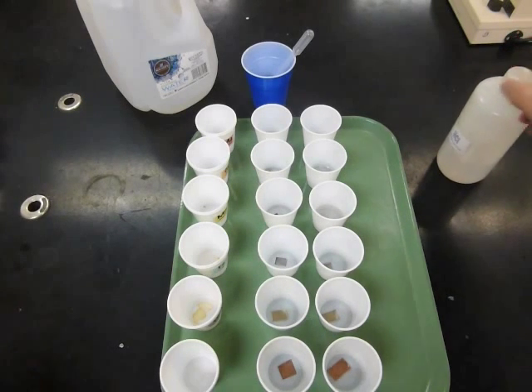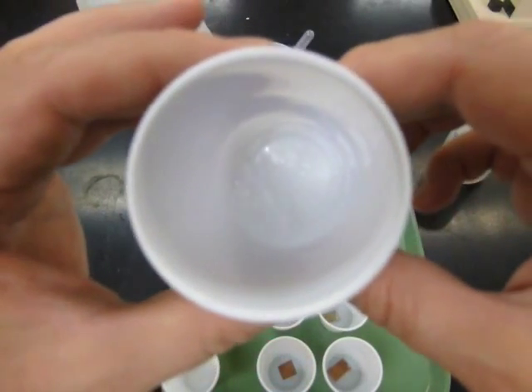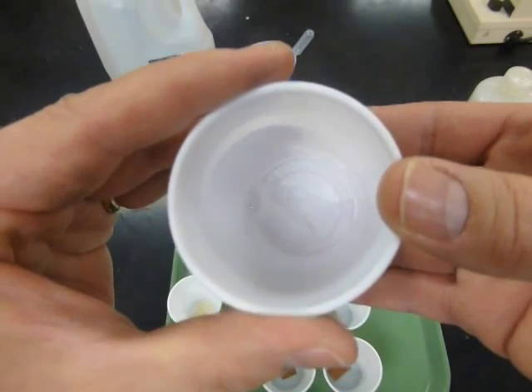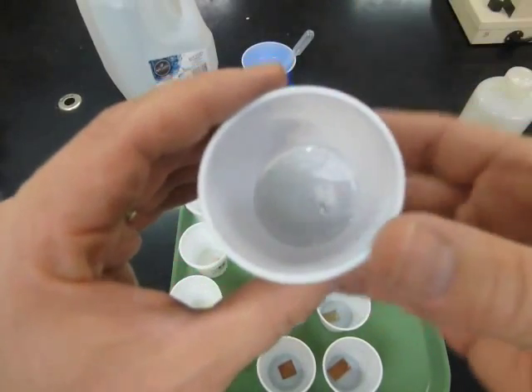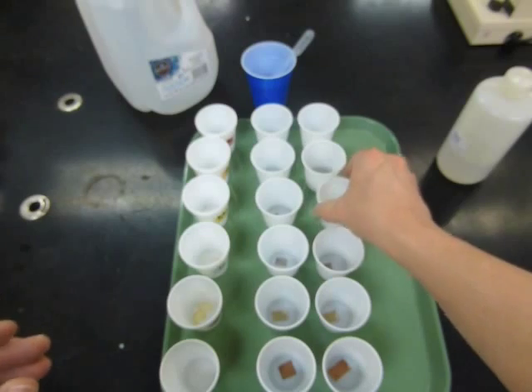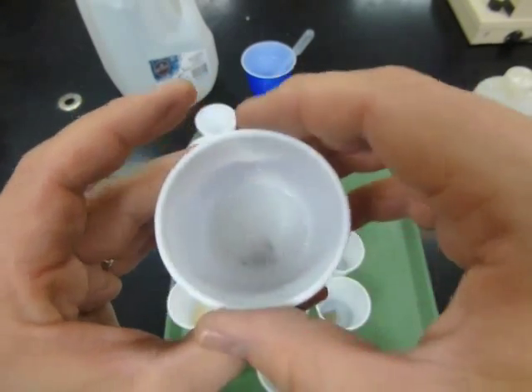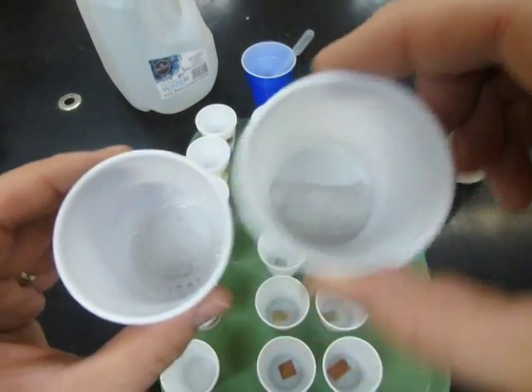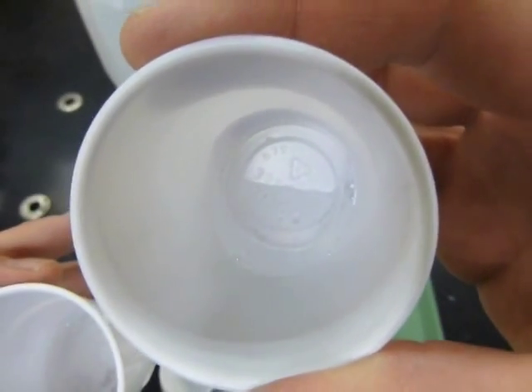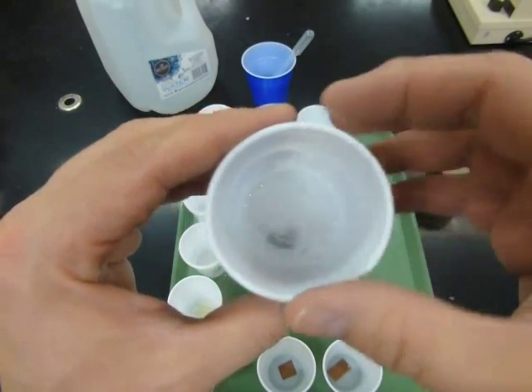Right away you can hear fizzing in the cups with the acid. Looking at the magnesium, there's quite a bit of fizzing and the cup is getting a little bit warm — you can even see some smoke. The calcium is a far more vigorous reaction and it's getting hot — pretty hot, I don't want to hold on to that too long. The manganese is also fizzing along, but it doesn't feel hot. Between the three, calcium reacts the most with a lot more fizz and very hot temperature. The magnesium is also reacting quite vigorously and is warm — and it's all gone, it completely reacted very fast. The manganese is reacting vigorously but with less heat and is not all gone yet.